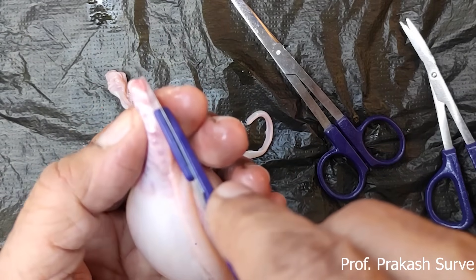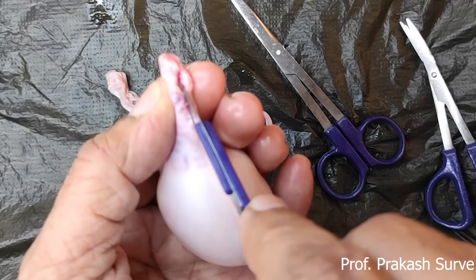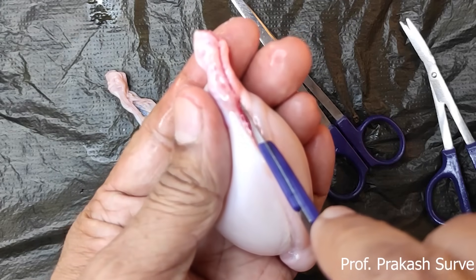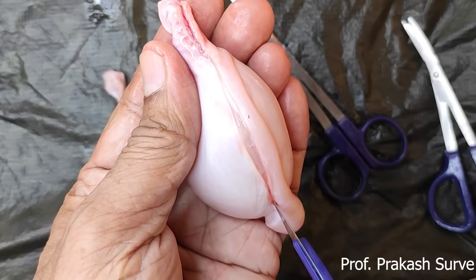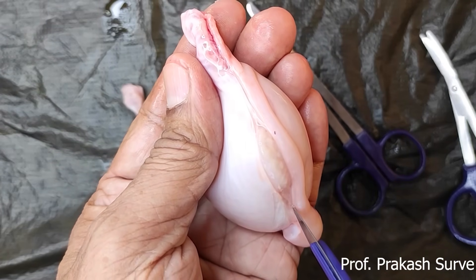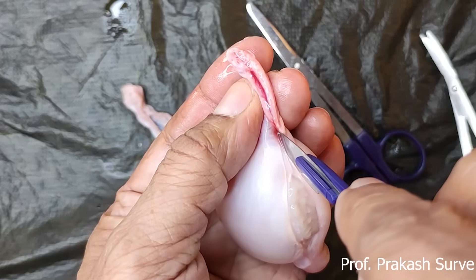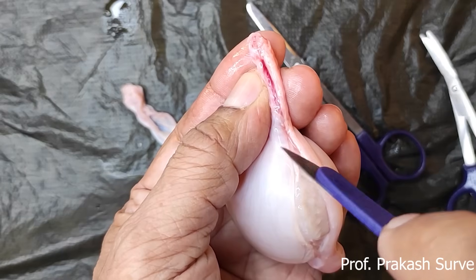We will now take the longitudinal section, that is LS. About the spermatic cord — then below that is the testis. The layer which is covered inner to the tunica albuginea is the tunica vasculosa, which is a thin membranous vascular layer. Inner to that we find many testicular lobules, approximately 200 to 300.